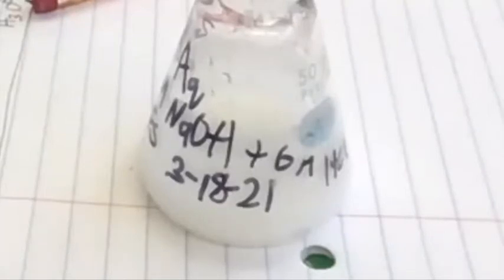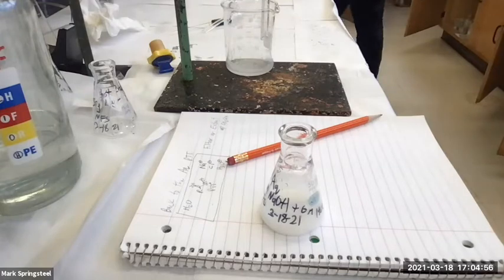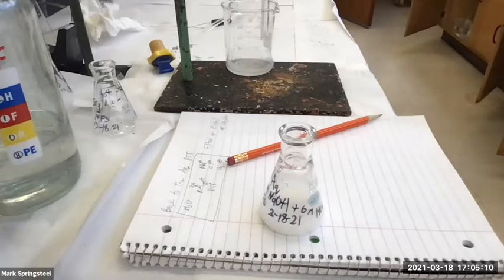Yeah. It actually, I know from experience, it'll filter pretty good. So we're good to go. I'm going to filter it. So we're going to do a vacuum filtration. You remember those? Or those of you, crystallization lab? I haven't had a lot of those turned in yet. But I showed a vacuum filtration during the crystallization lab, and now I'll show you that.